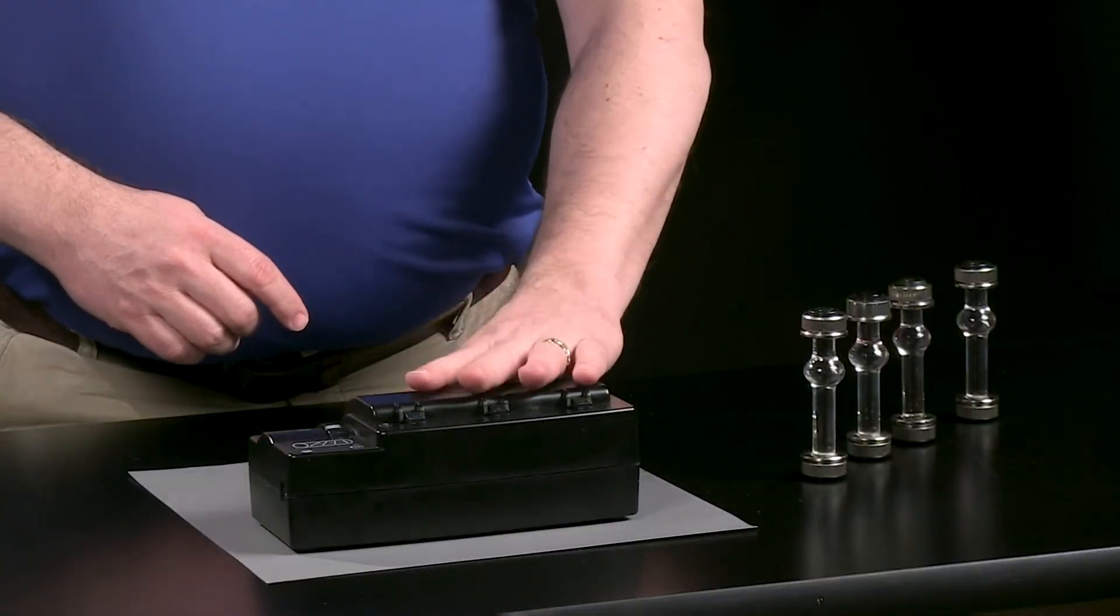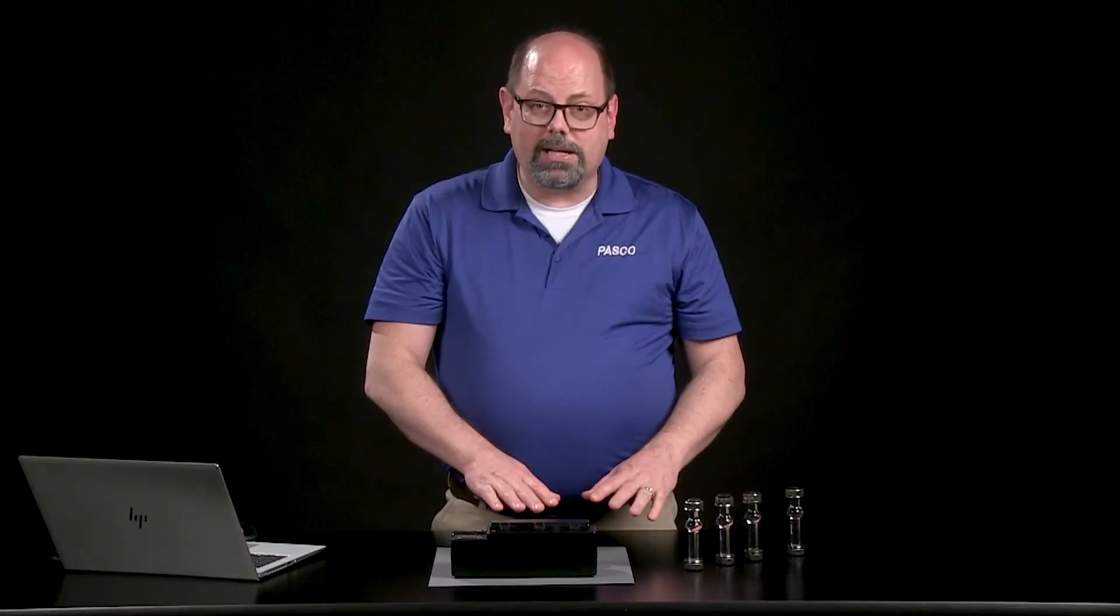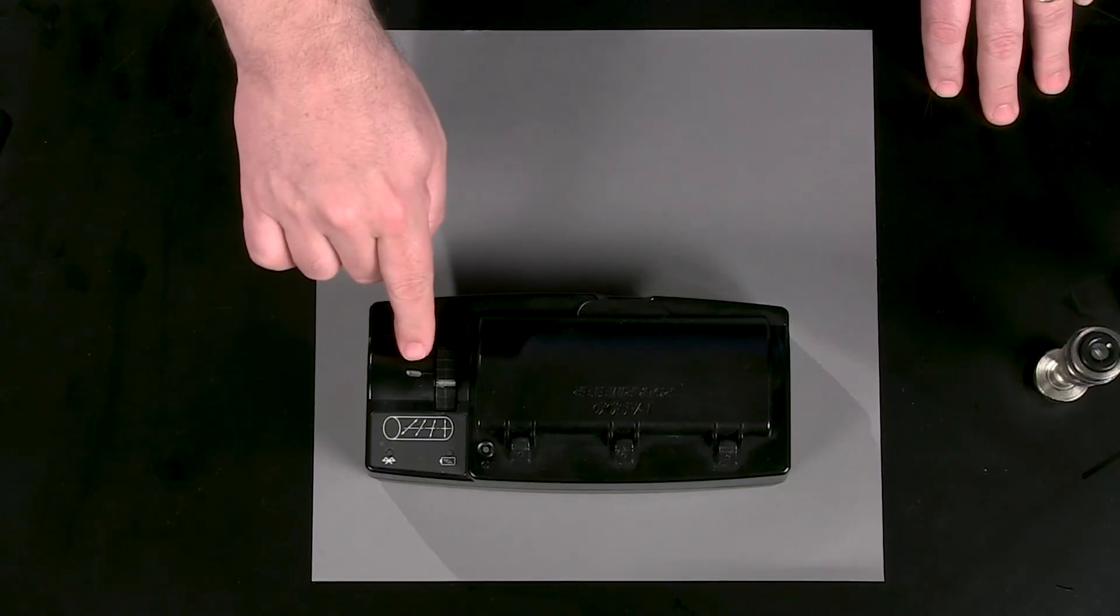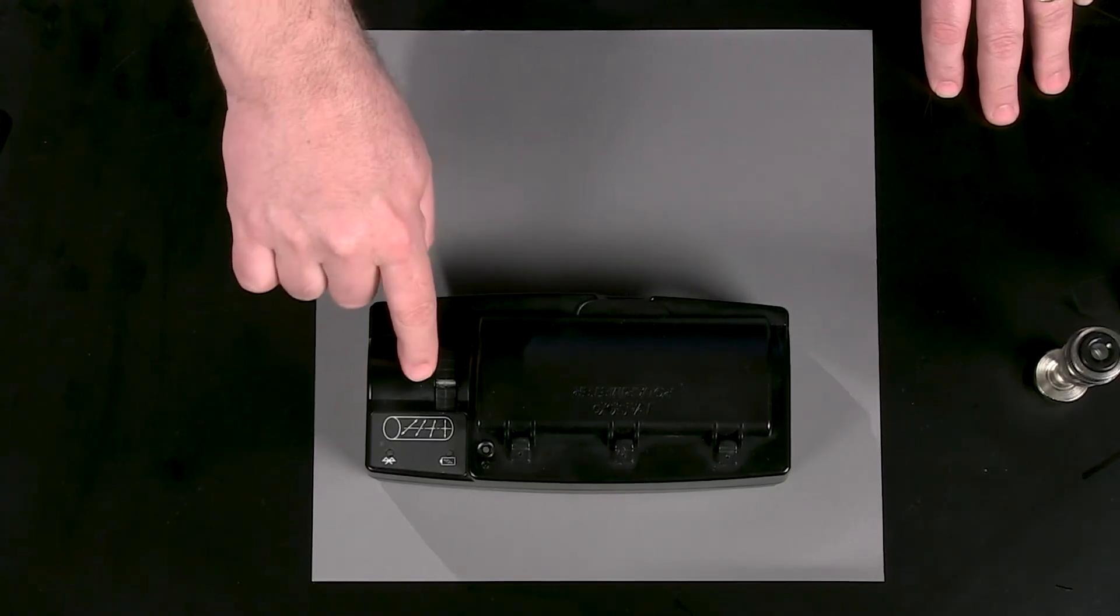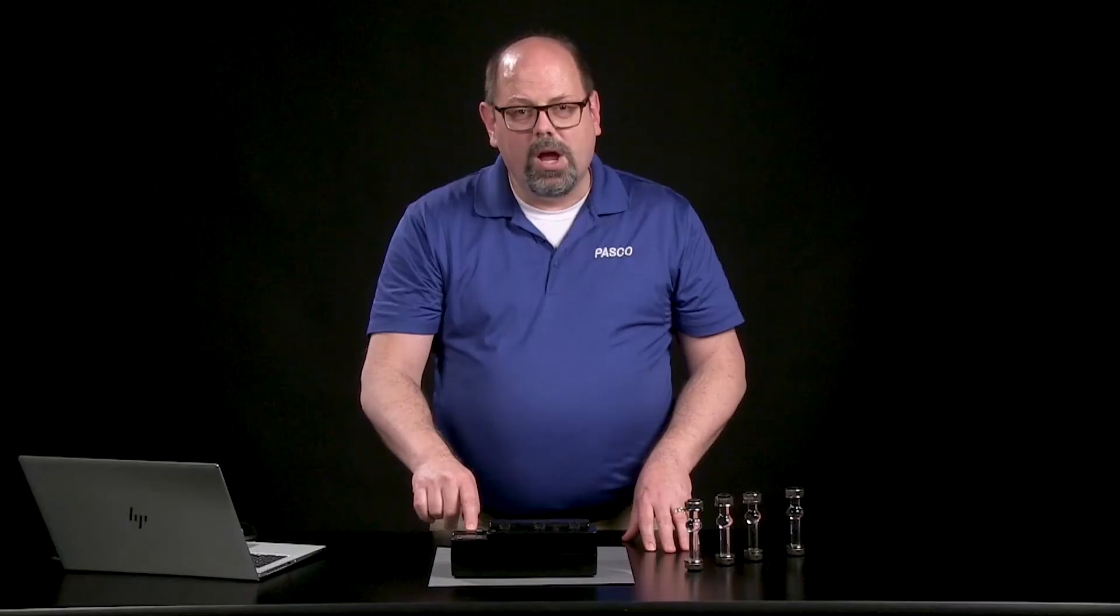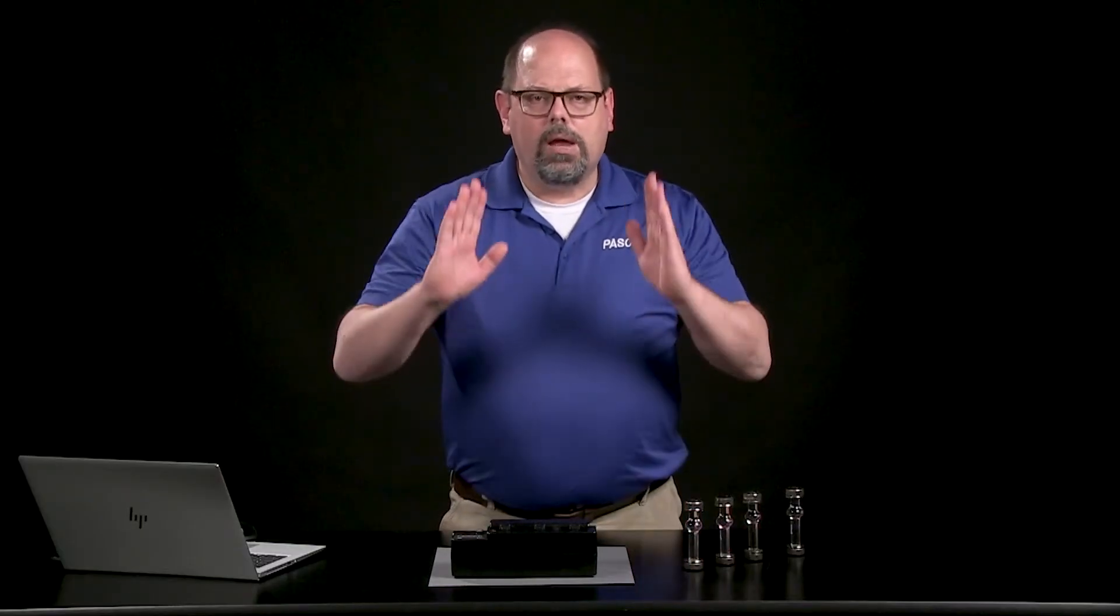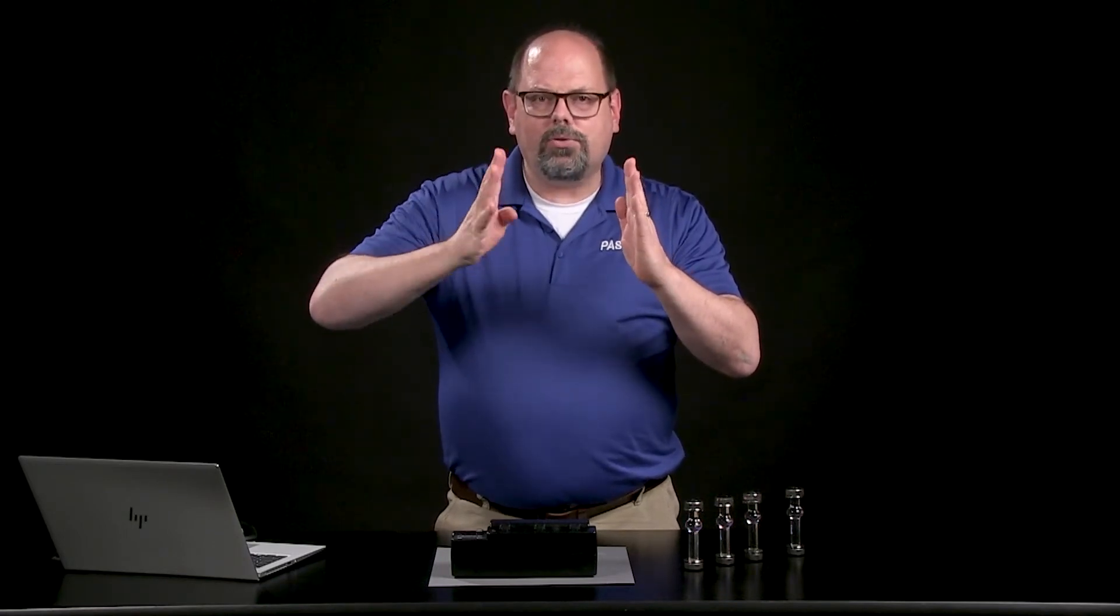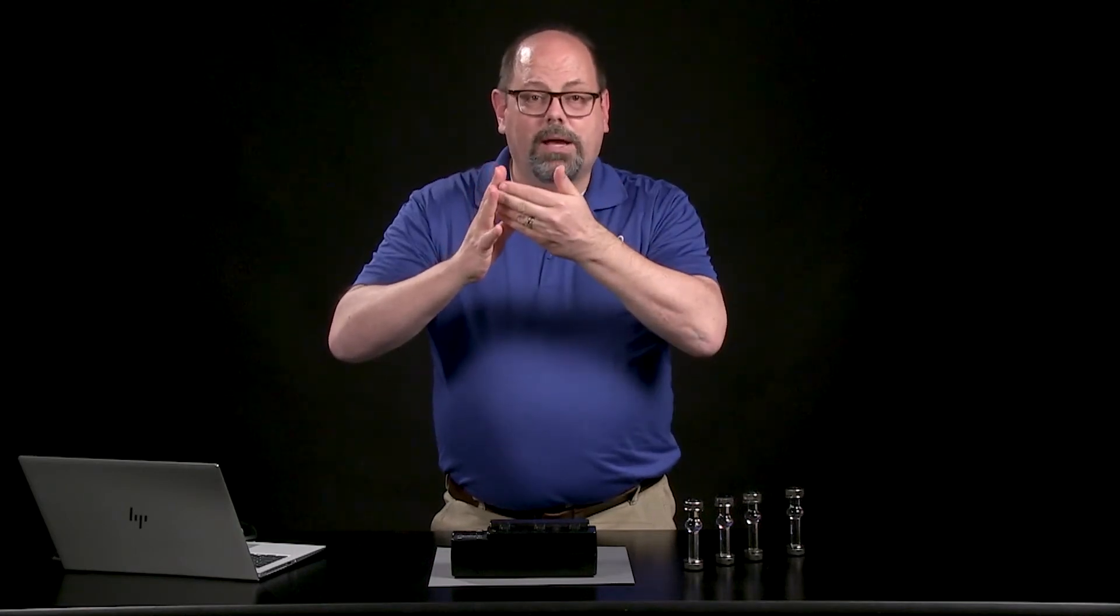I'm going to turn that down so we don't have stray light coming in from some other source. You'll notice I marked the polarimeter with a place. There's actually a little notch on here to tell you relative if you're spinning this dial. What you're doing is spinning the second cross-polarizer until you get to a place where the light coming through is maximized.